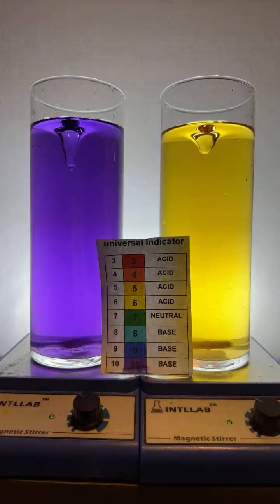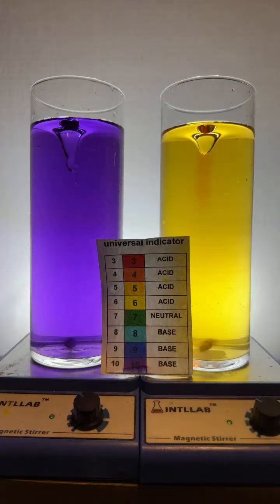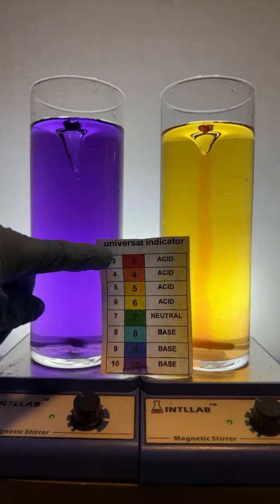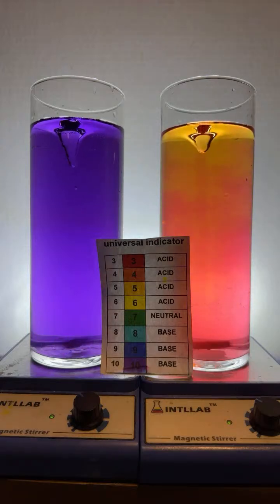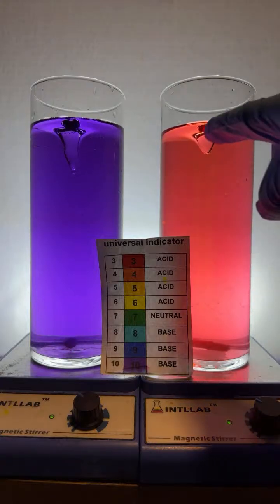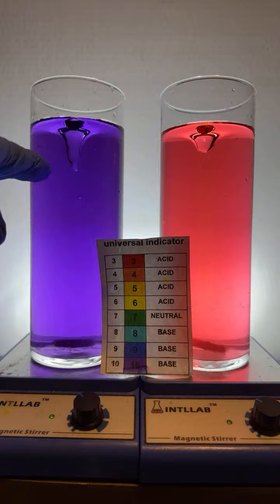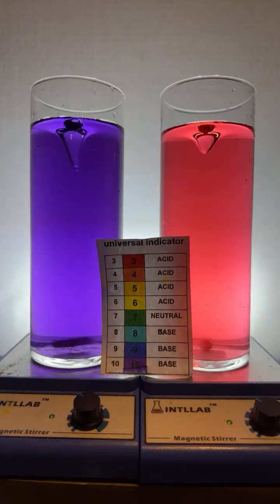Over here on this side, we're going to add some acid, hydrochloric acid, the same acid that's found in your stomach. We're going to do 2 drops over here on the right. 1, 2. That red color you see in the center of the vortex tells us that, indeed, I've added some acid. And look at that, the whole thing's turning red. So yeah, in this flask, we've got a highly acidic mixture. Over here on the left, we have a highly basic mixture.